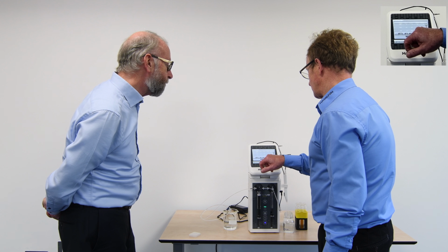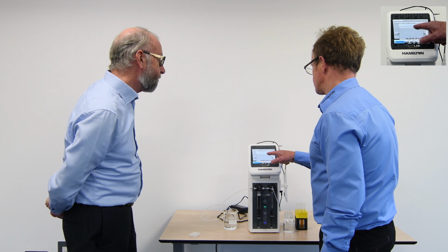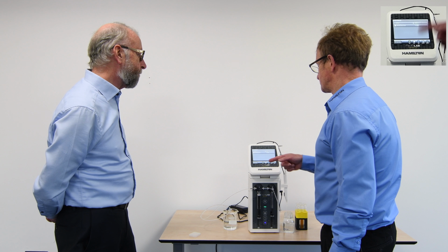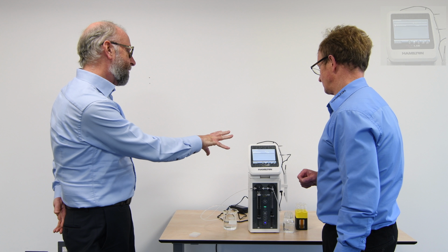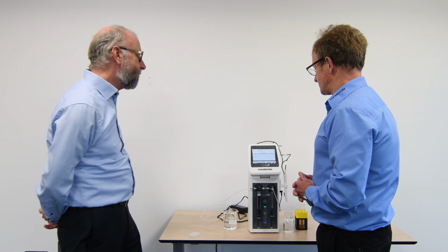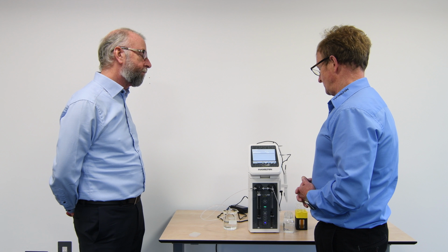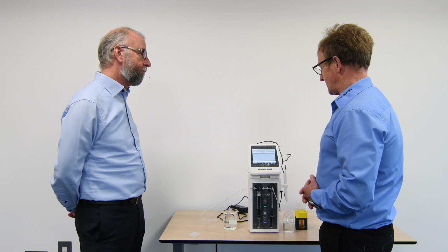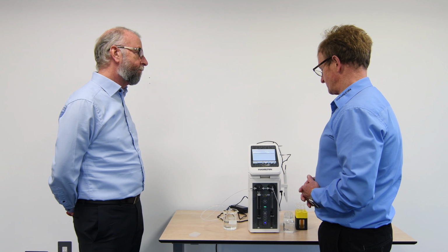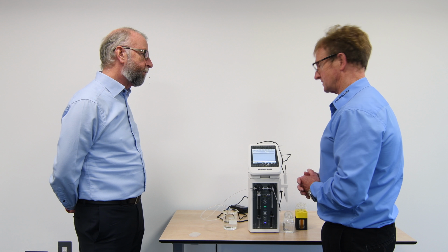But essentially now we've actually got that program in, we can come back out to custom methods, and it asks us, we're going to save before leaving the screen. I say yes, it's now stored that change of program. And this can be password protected. Exactly. All the methods can be password protected. The instrument is CFR 21 compliant. We have an administrator and a user mode. And the administrator can set up the programs which allow users to access the programs but not change them. And it has full traceability on the documentation it's generating.